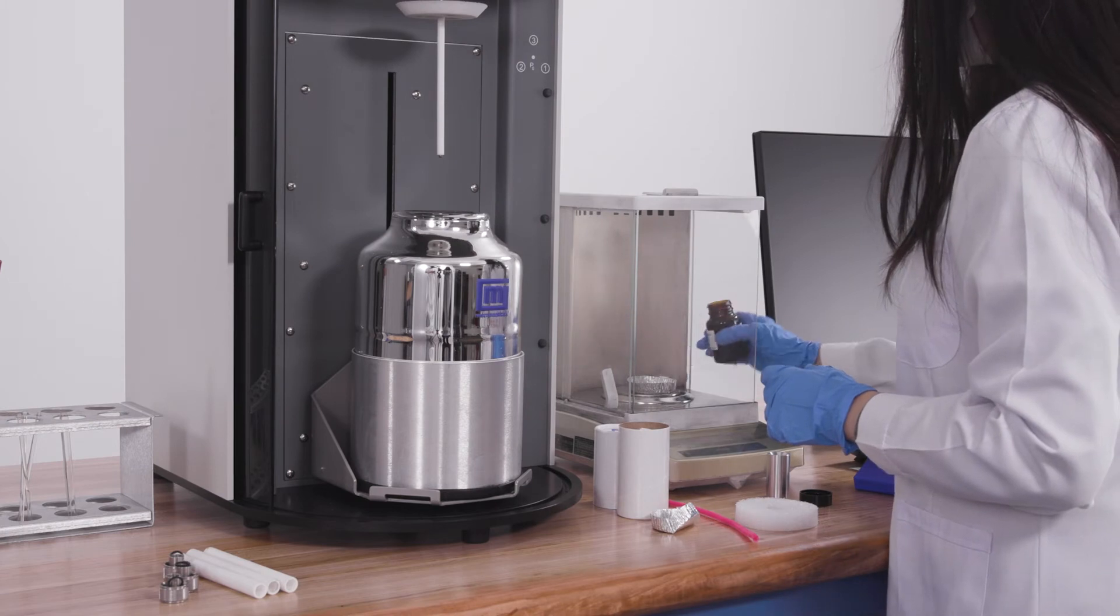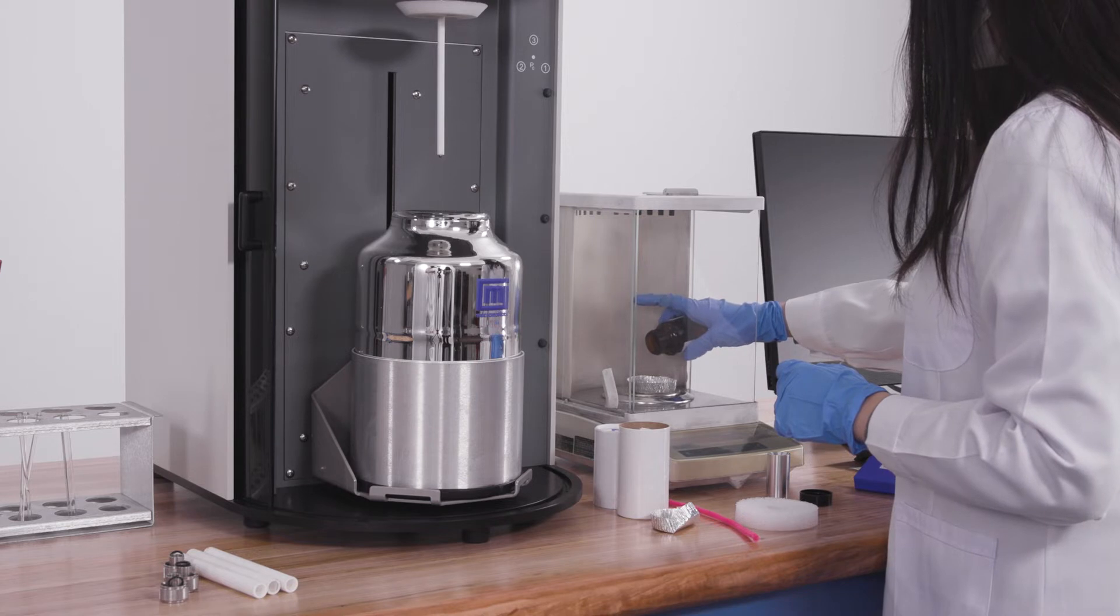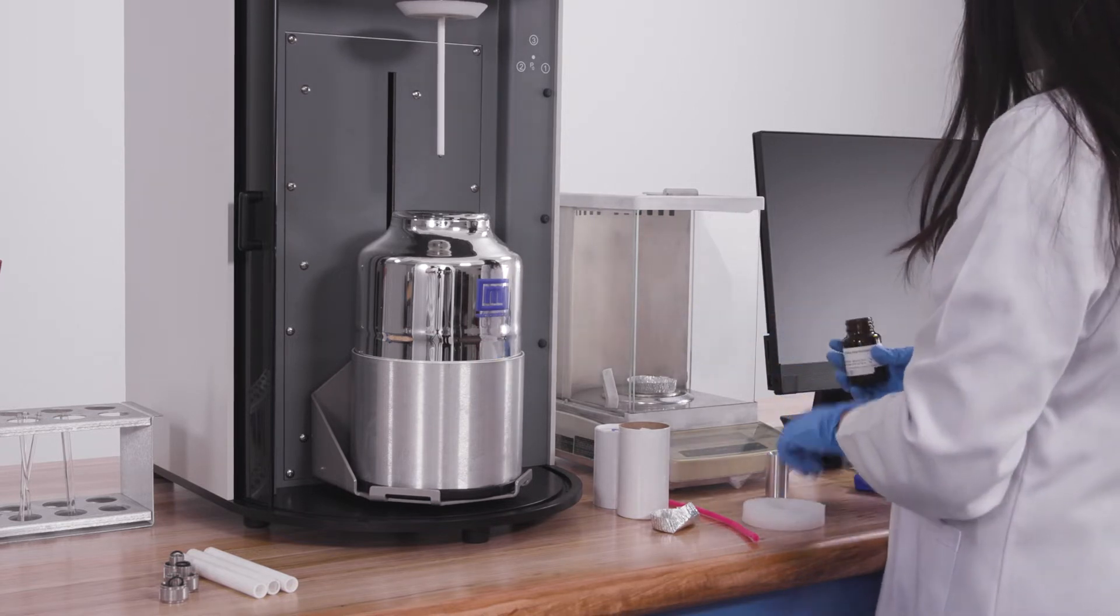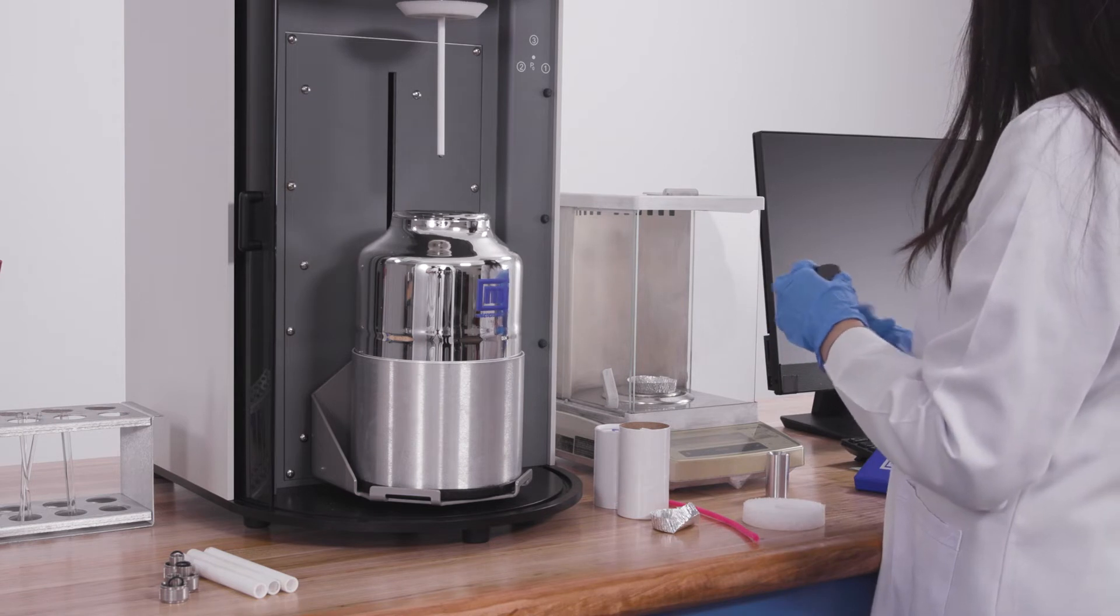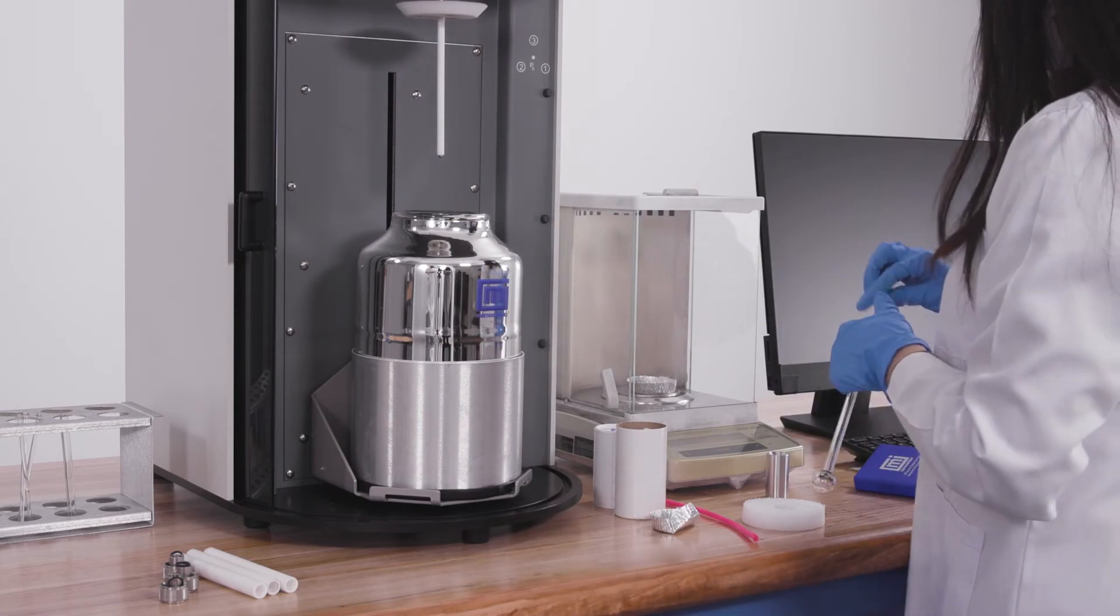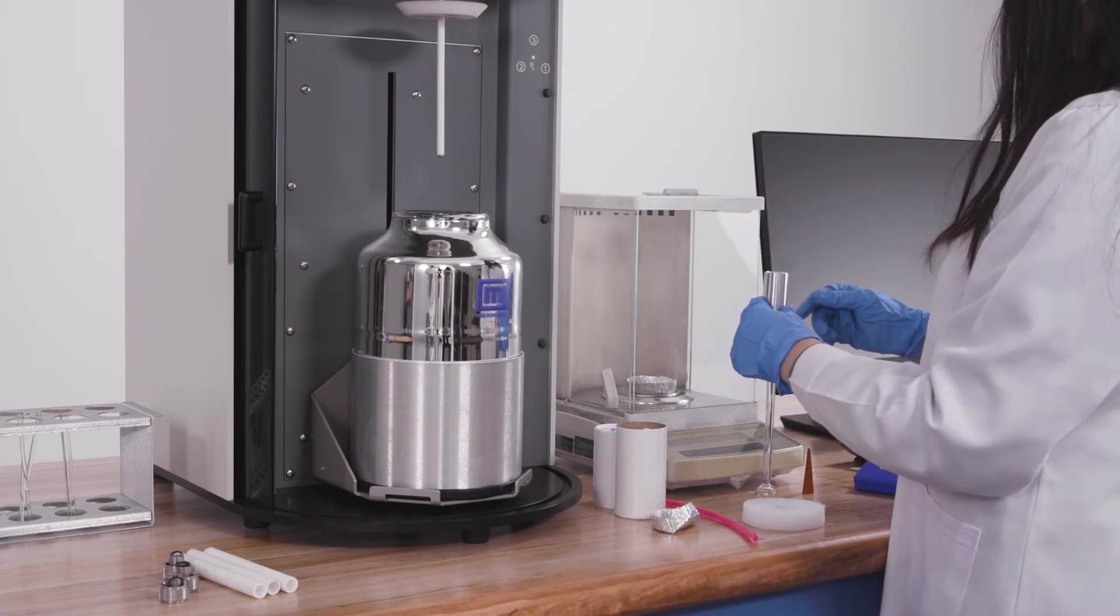Weigh out the appropriate amount of material on a weighing dish and transfer the sample into the sample tube using a funnel.